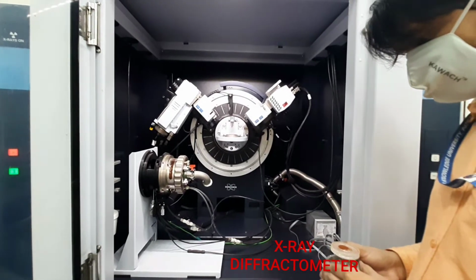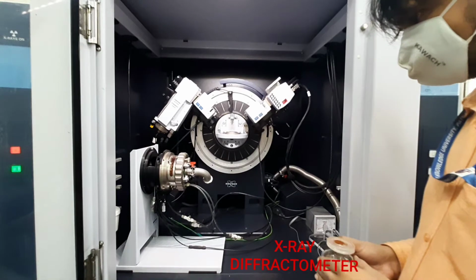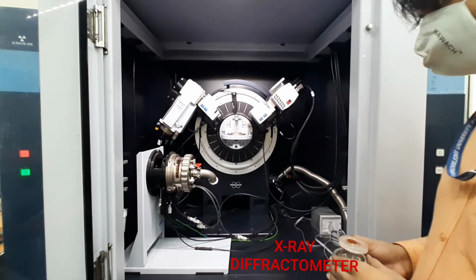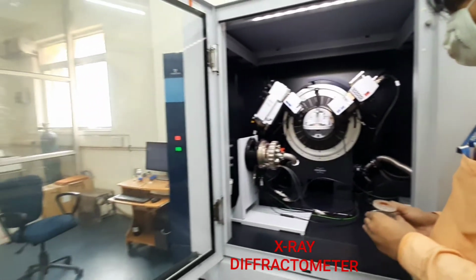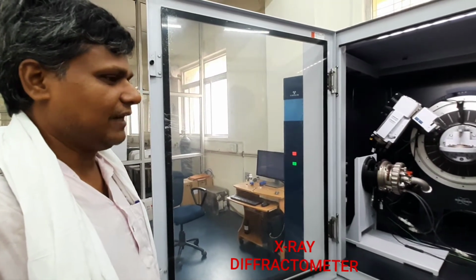interplanar distance, and whether the material is formed or not. If formed, whether it is an amorphous structure or a crystalline structure, or both crystalline and amorphous. These parameters can be determined using the X-ray diffractometer.